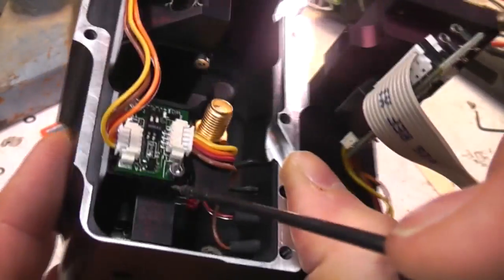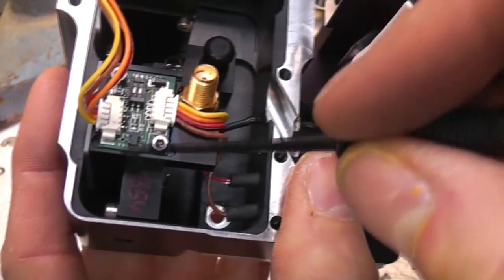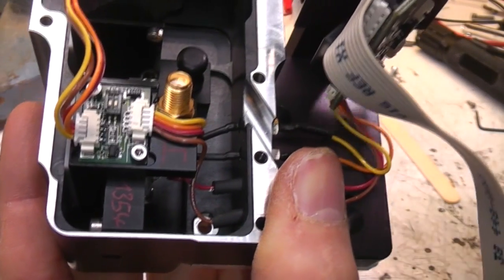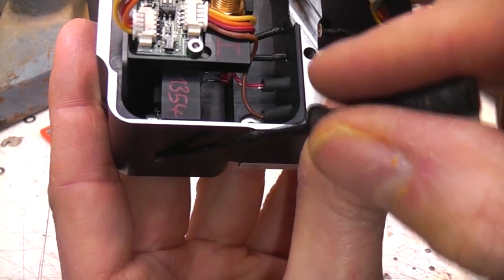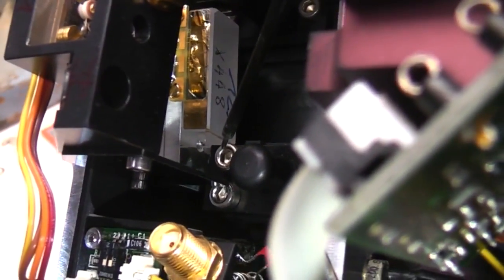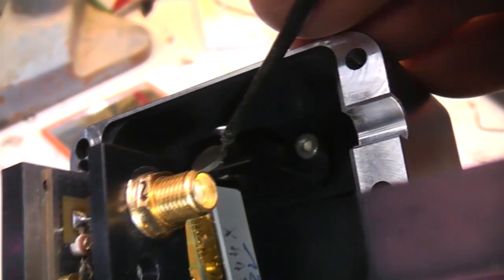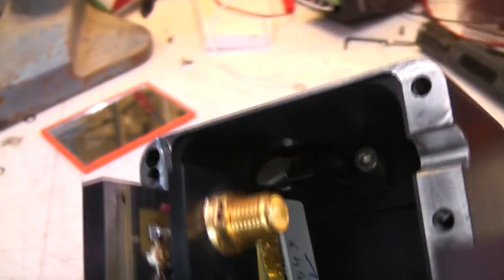It's not clear whether these crystals are similar. I think this one might be the magic one that actually does the beam splitting. I'm not sure if it's the same type as this, whether it's one of these tunable wavelength things or something slightly different. It comes out the bottom, that then gets reflected back to the fluorescent signal, which is at a different wavelength, which is the one that wants to be separated out. It goes back through this same crystal, then up, hits this top crystal, passes through, and then there's a little pair of mirrors that act like a sort of periscope just to shift this back down again, back to the original beam path, and then out.